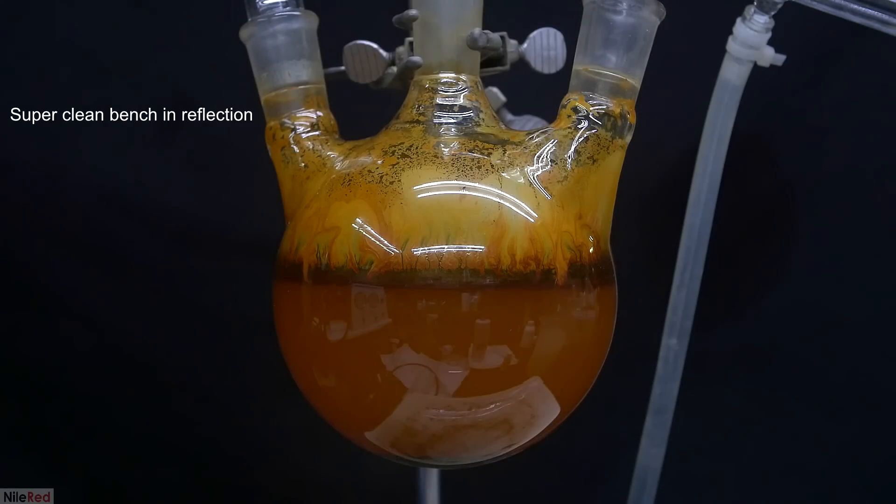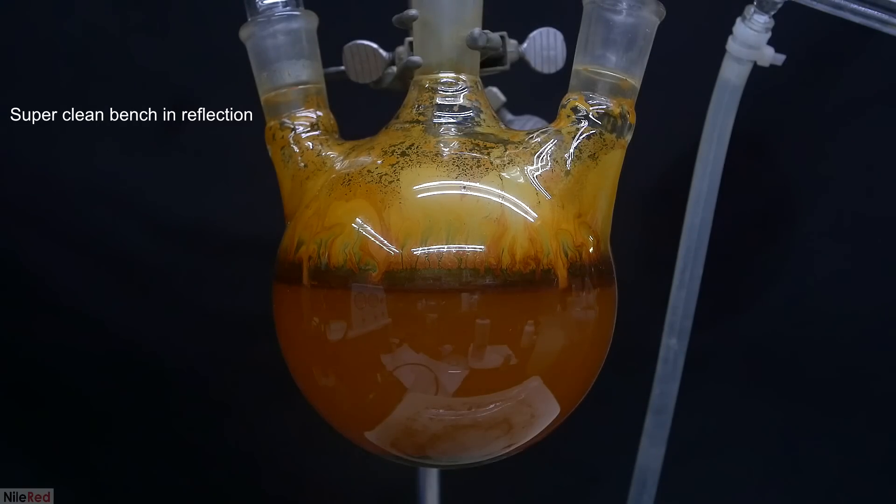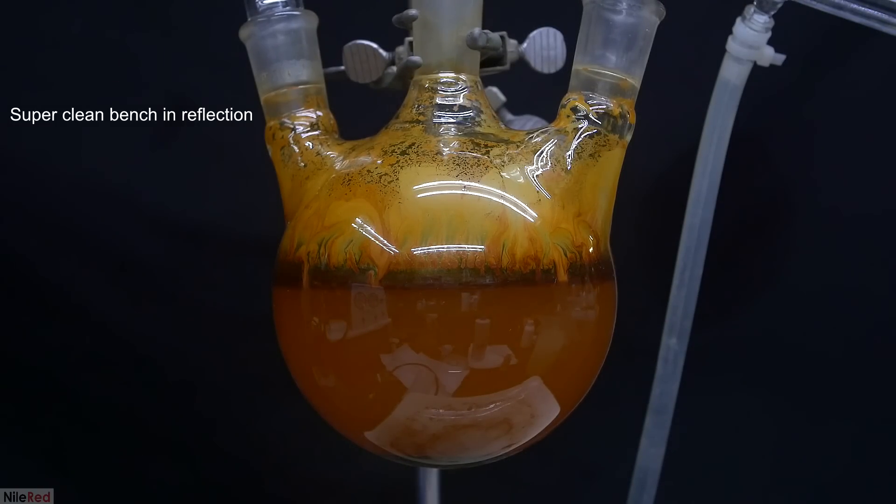When we take a look at our flask after the steam distillation, we're left with a pretty dirty brown solution. I don't show it here, but for what it's worth, I let it settle out and it didn't look like there was much oil left.